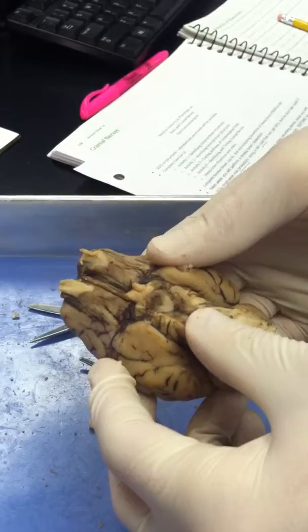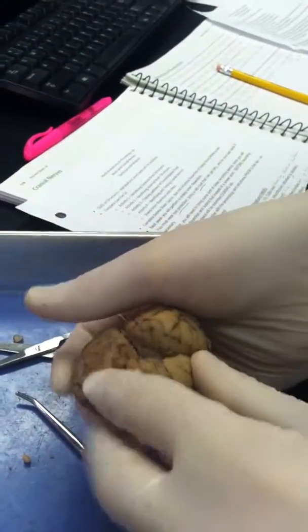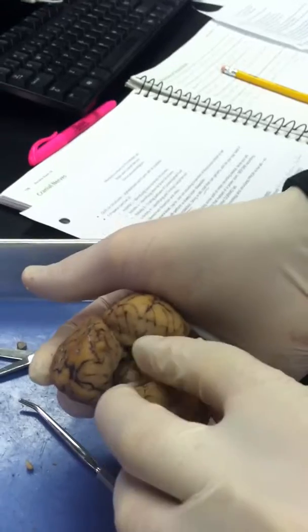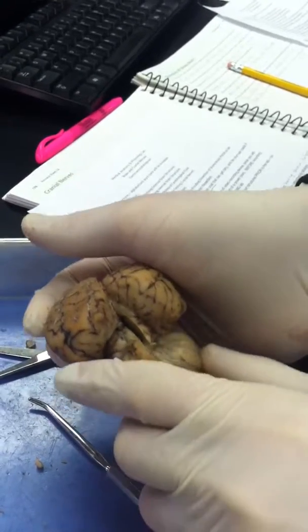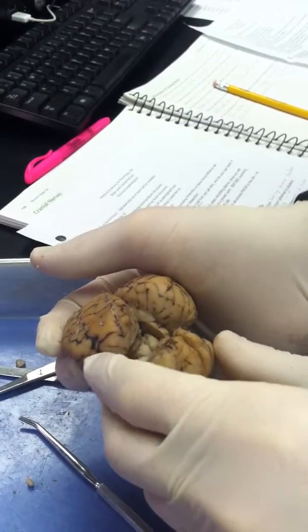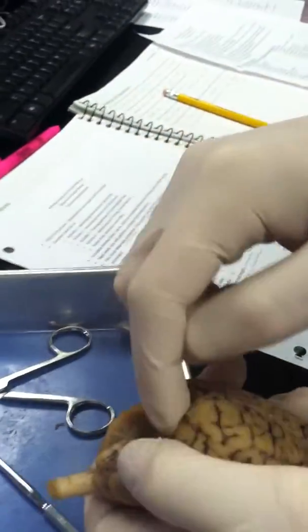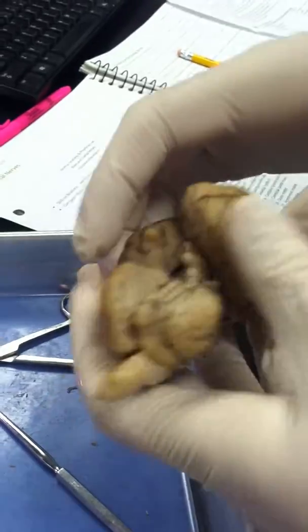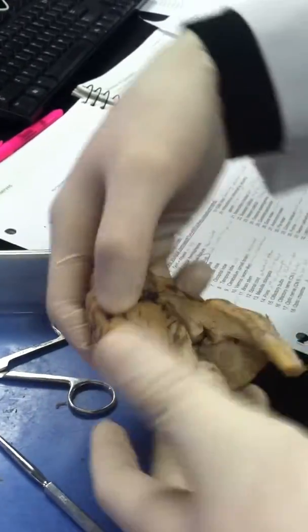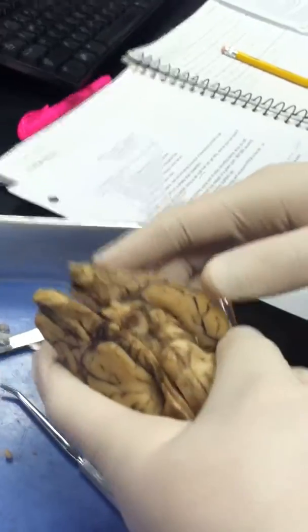The superior colliculi are in here. Turn it over. Yeah. The superior colliculi are on top, right here, and the inferior colliculi are below it. The corpora quadrigemina, this whole thing together, contains the superior and inferior colliculi. The cerebral peduncles are right here. You did such a good job. Or no. Mm-hmm. Okay. I'm so proud.